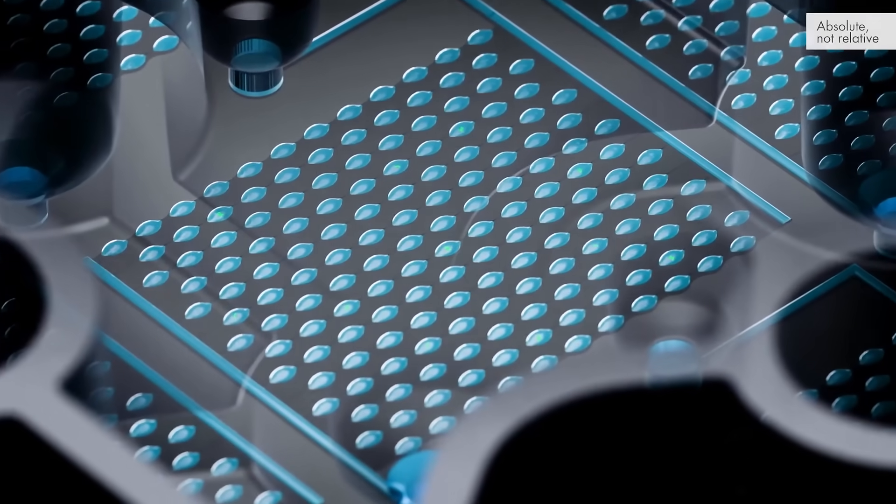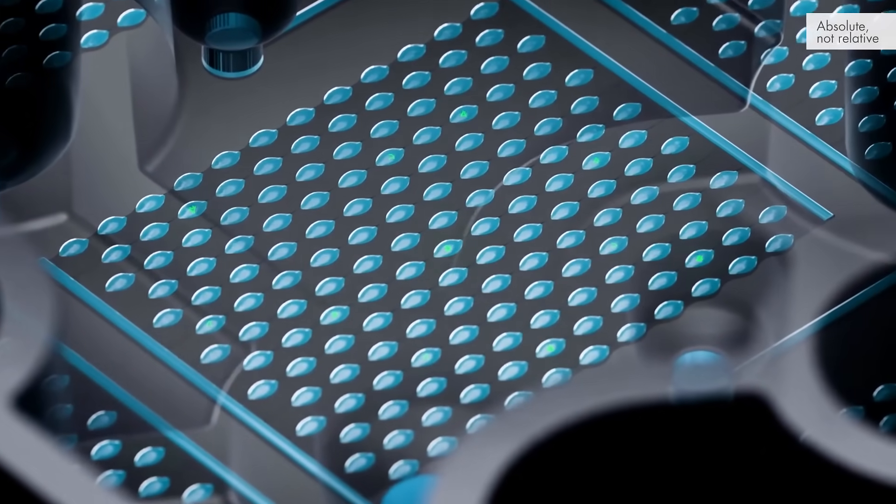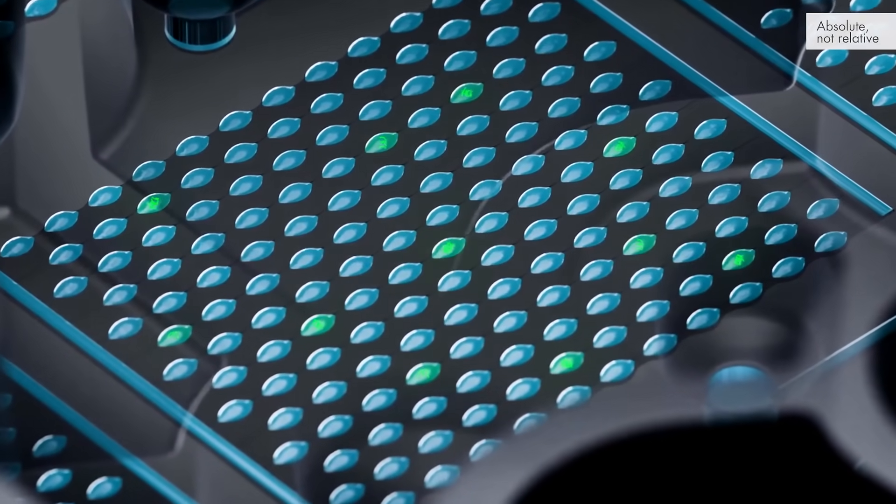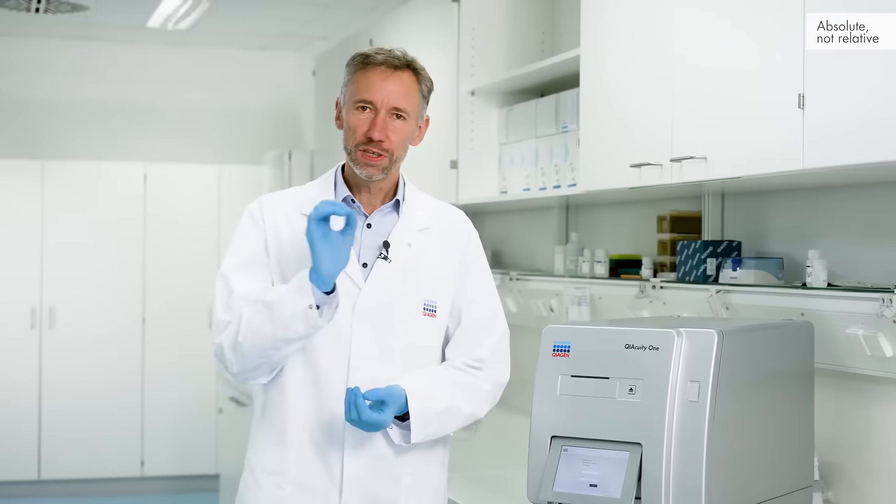The PCR process is applied to all the partitions, but the amplification only happens in those partitions where the target DNA is present. Each partition that contains the target DNA creates a signal, and those partitions that create a signal can simply be counted.